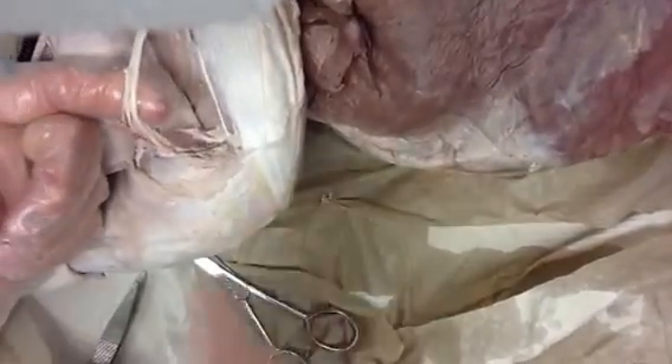If we follow this back up, look at the size of the sciatic nerve. That is a big nerve — that's the largest nerve trunk in the body. It's going to carry branches down all the way into the toes. This is a great one — you can just lift the whole cat up off the tray by these nerves because they're so well-wrapped with dense regular connective tissue. So that's the sciatic — really easy to find, really obvious.